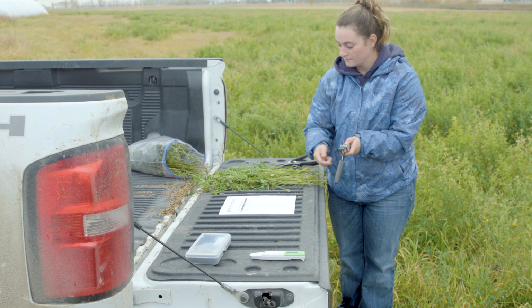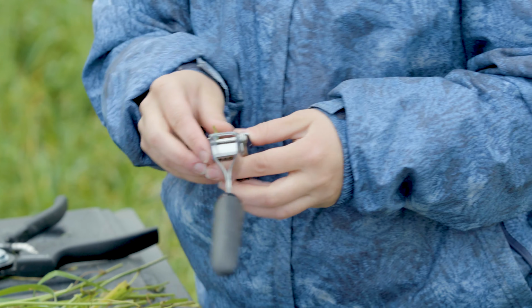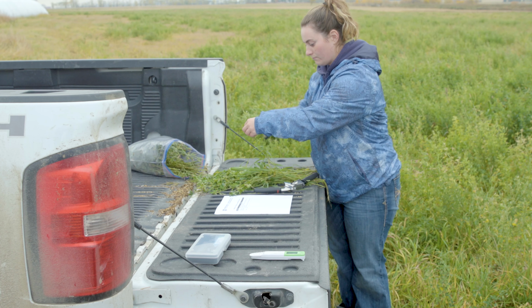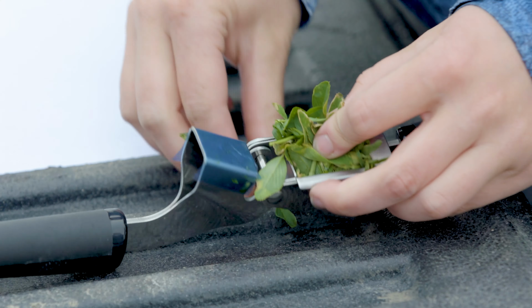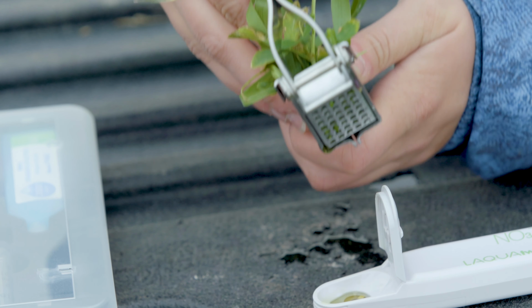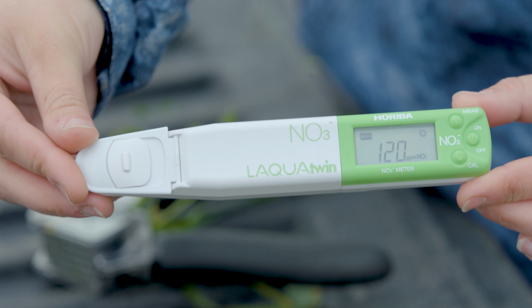Next, you can take samples from multiple parts of the bag, including various species and parts of the plant, including stems, petioles, and leaves, and put them into your garlic press. You will then take the garlic press and squeeze 1 drop from the press onto the sensor pad. Once you've put your droplet in, close the tab, and once the unit is done taking the reading and the reading is stable, it will show a smiley face.